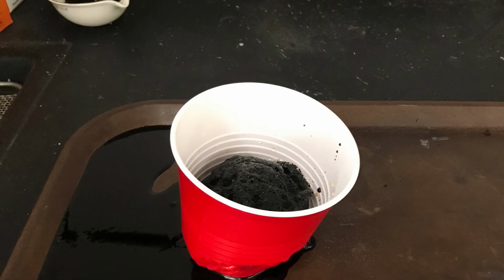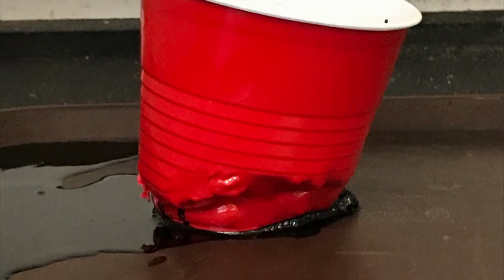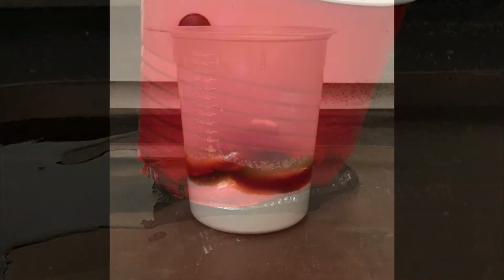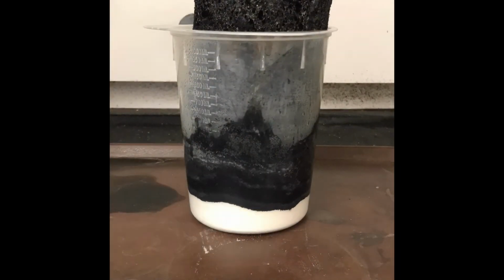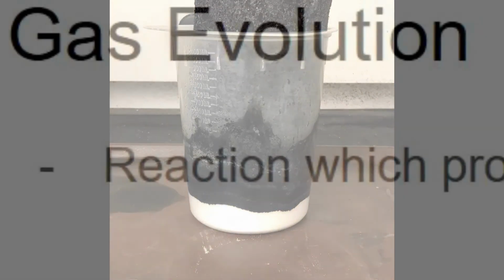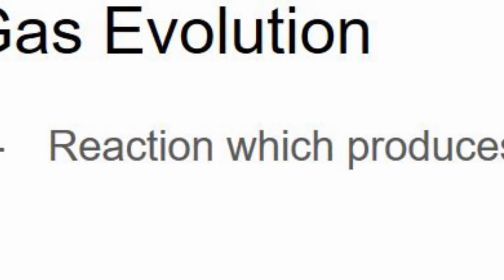The reaction is extremely exothermic, and you can see that I accidentally melted the cup the first time I tried it. Although both sulfur dioxide and steam are colorless, you can clearly see them escaping the reaction as it progresses, thus proving that this is a gas evolution reaction.